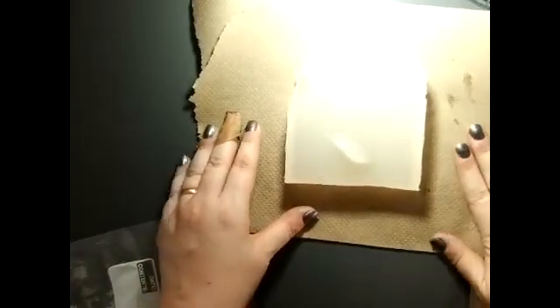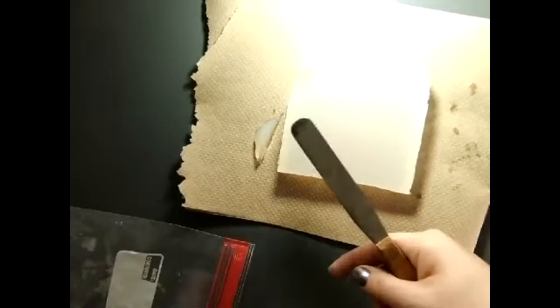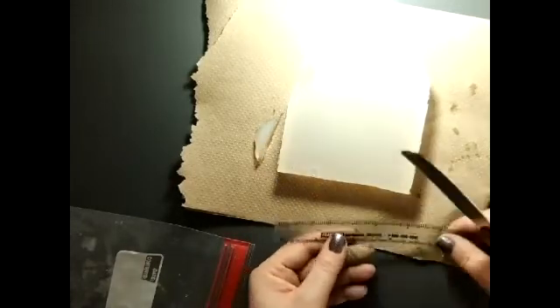So the first part of what we need to do is cut a piece of agar into 3 cubes, one of them 3 centimeters, one of them 2 centimeters, and one of them 1 centimeter. I have here a piece of agar, and this is the same substance that was in one of the prior experiments in the Petri dish. This one is just a big hunk of the same substance. I have my metric ruler and a putty knife, and I'm just going to cut it as best I can.